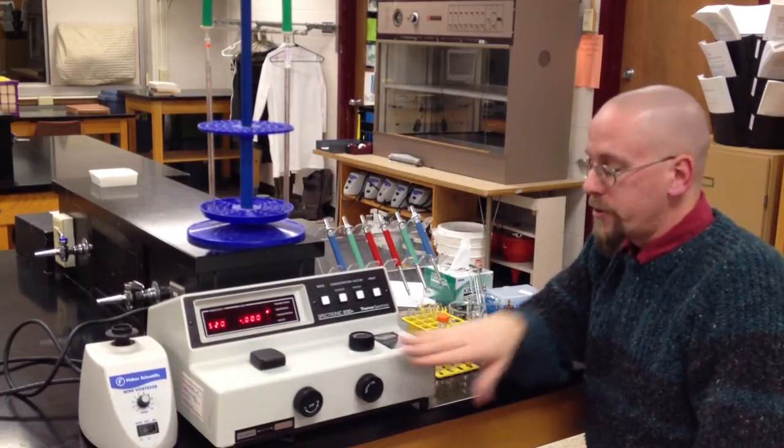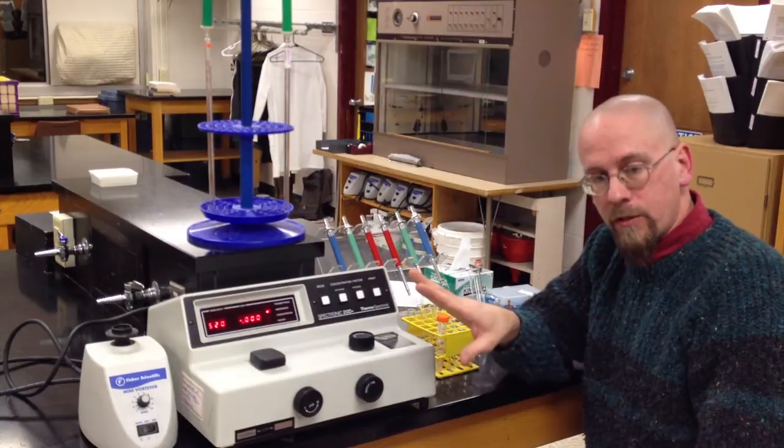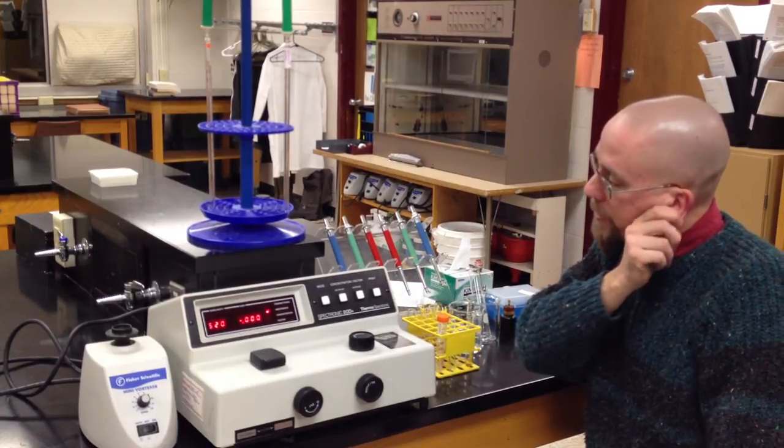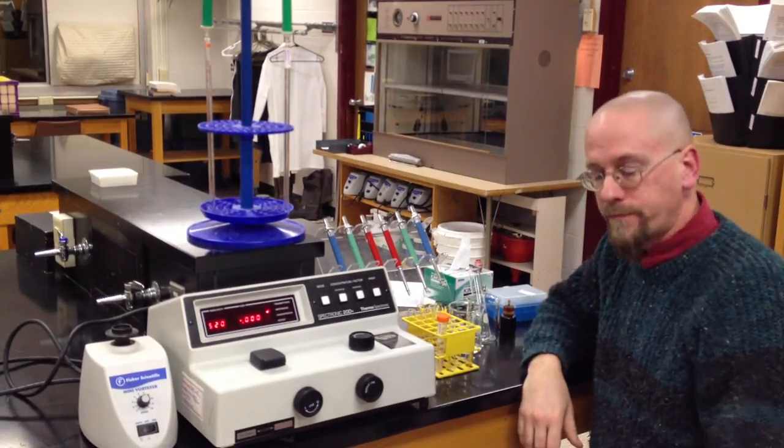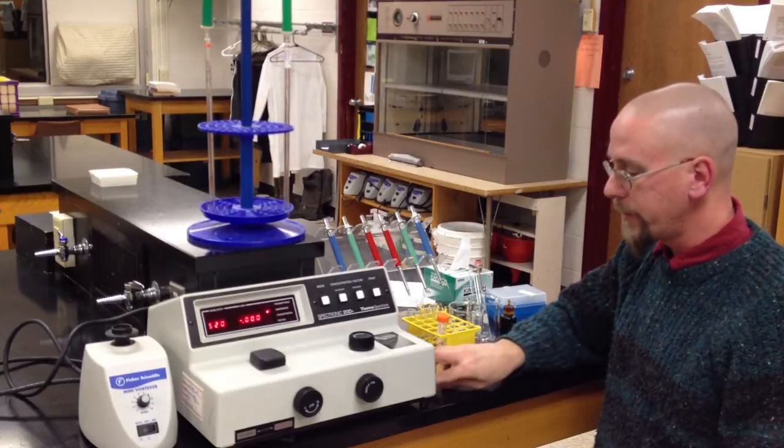Once you've done this, your instrument is set up and ready to go. Then what we'll do is take a look at our protocol and see how we're going to investigate this process.